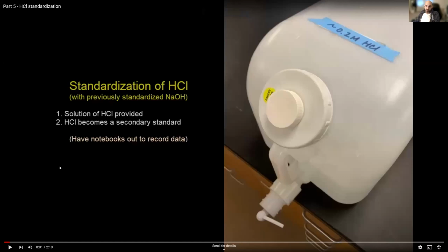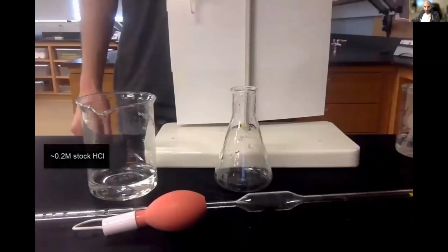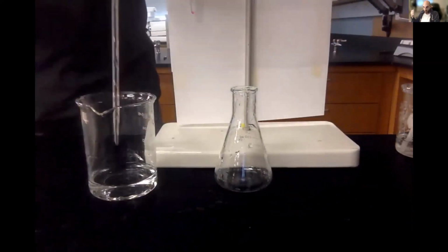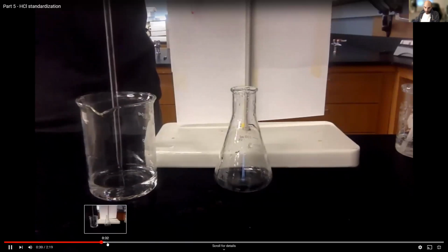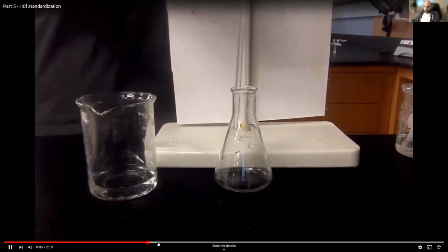So again, we're given a solution of HCl provided. HCl becomes the secondary standard. Don't worry about that. So we have this solution that's around 0.2 molar. I'm going to take some of that HCl, 20 mils, a volume of 20 mils, like I had in the thing that I just finished. I'm going to add it to my Erlenmeyer flask. Let me speed this up a little bit, although it's quick.